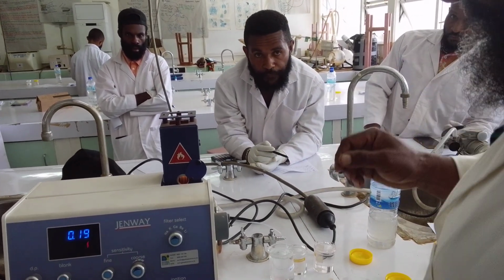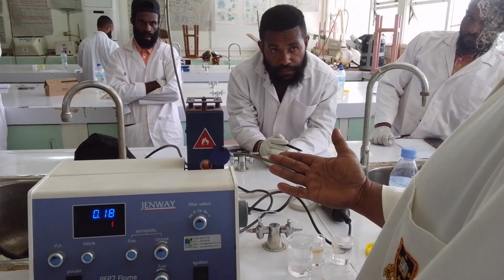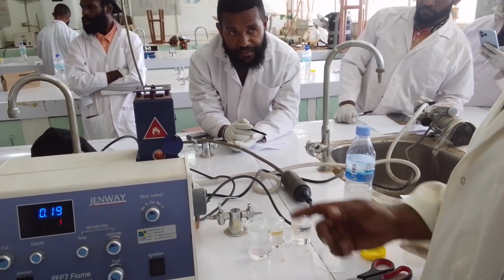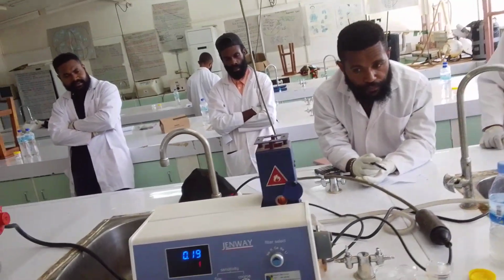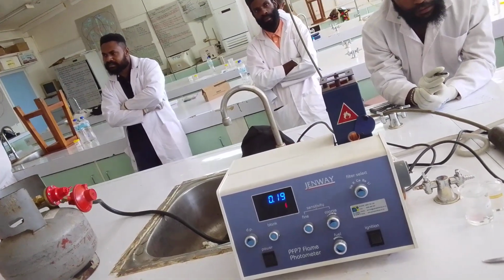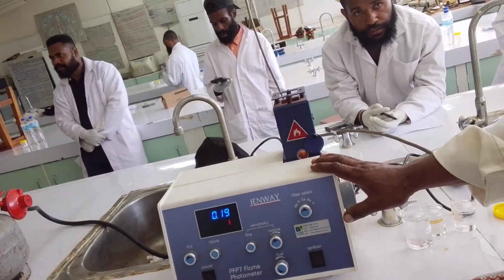It's because some of the air from here that goes in, I was just in the way. I pushed it right in, it was in the way for the air to increase the flame. You need oxygen to aid the flame, so it was in the way of the air from the pump. That's why it did that. Any sample from here is carried in with the aid of the aspirator. It sprays the samples into the flame. That's why it's called the flame photometer.